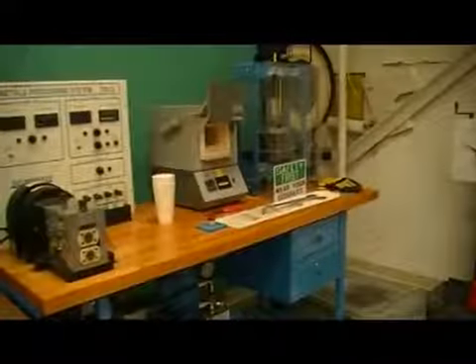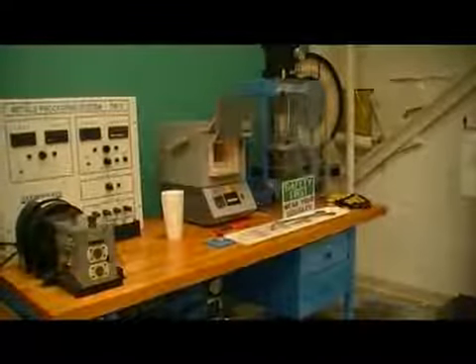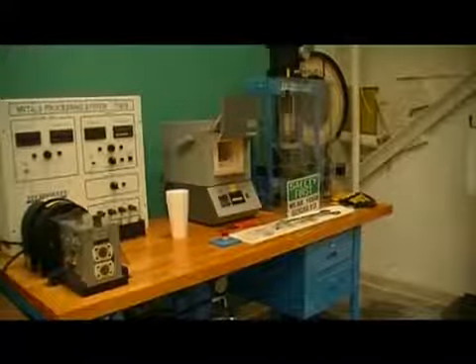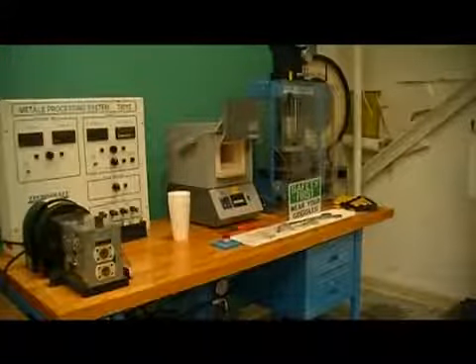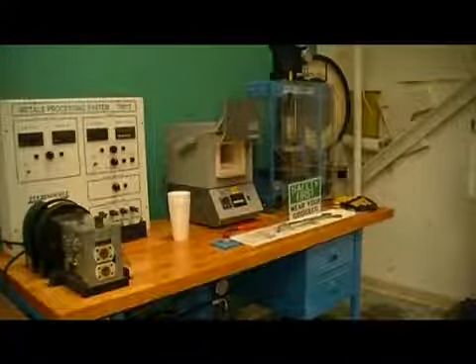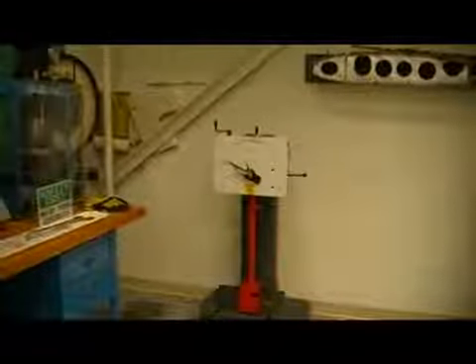External conditions affect the toughness of a material, and in this lab, two external conditions will be varied. First, temperature will be varied amongst the samples between hot, cold, and room temperature. One should find that cold temperatures tend to make a material more brittle, while hot temperatures tend to make a material more ductile. The other external condition that will be tested is geometry, specifically the geometry in which the sample will be held when it is struck by the hammer.